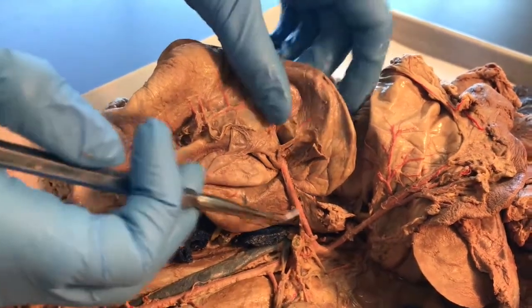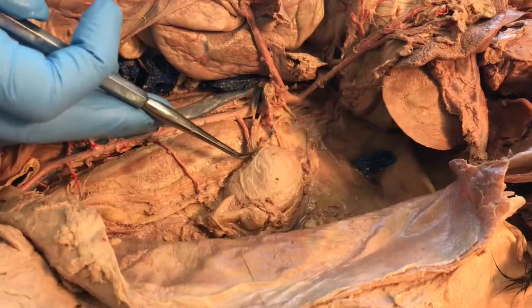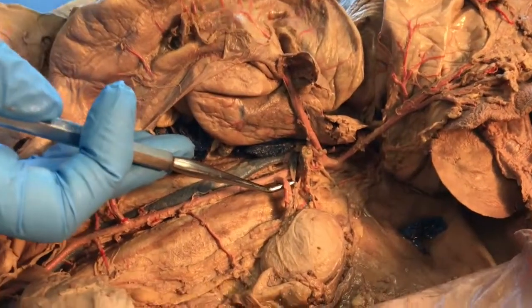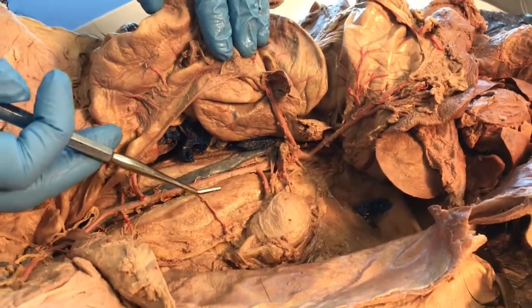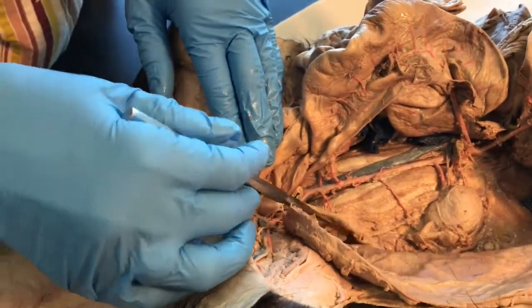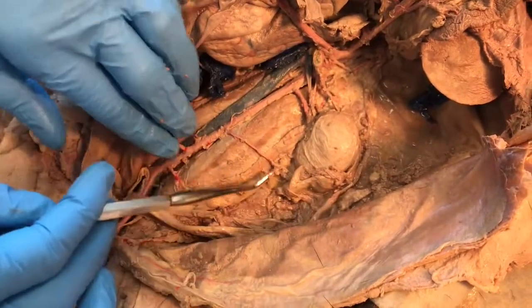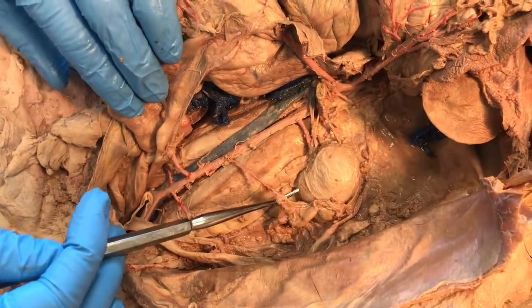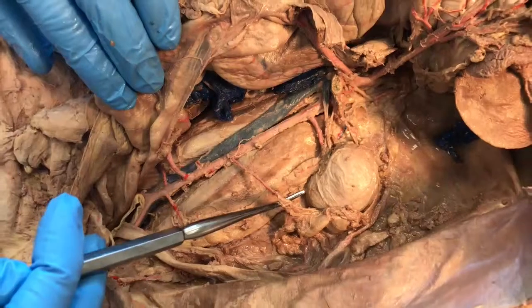The next branch we need to look at comes from the kidney. When trying to locate this branch, just find the kidney and trace it back to the abdominal aorta — you will find the renal artery by doing that. So here's the renal artery going to the kidney. We also need to find a gonadal artery. This is a female cat, so we can find the uterus, fallopian tube, and ovary, then find the artery pointing to it. This is a gonadal artery — or, because this is a female, we call it the ovarian artery. This is the left ovarian artery.